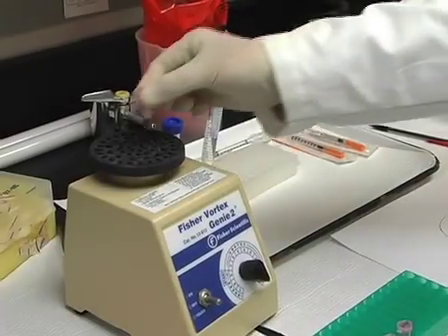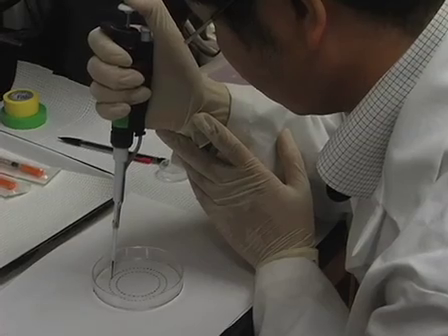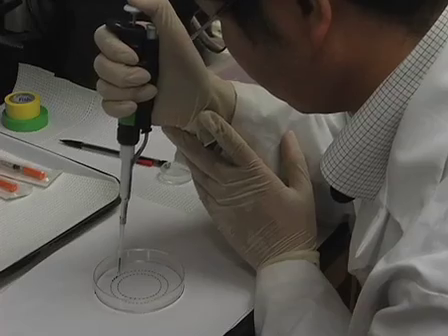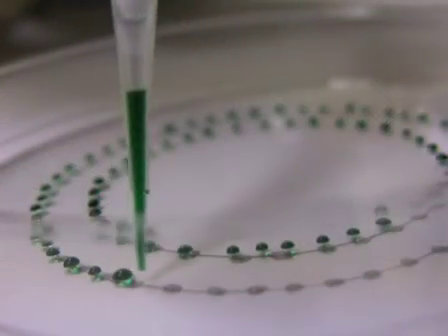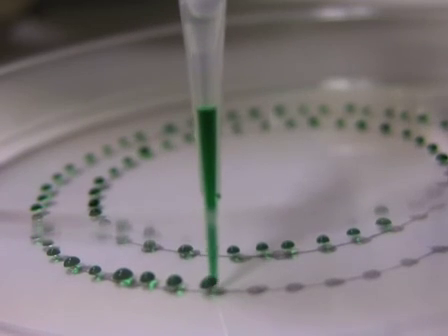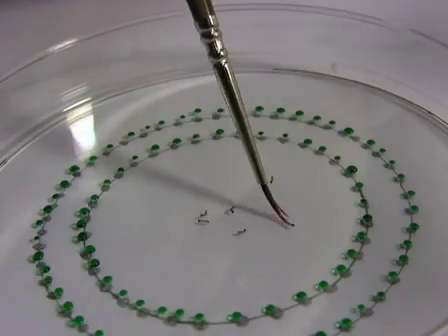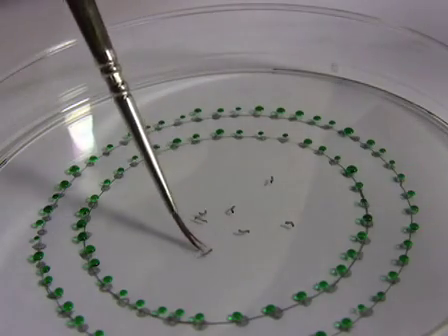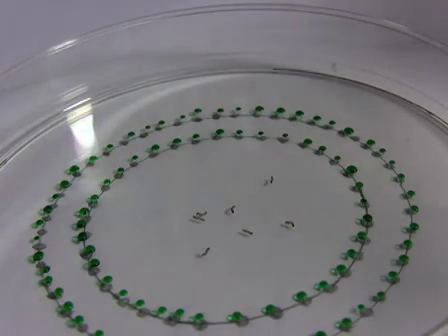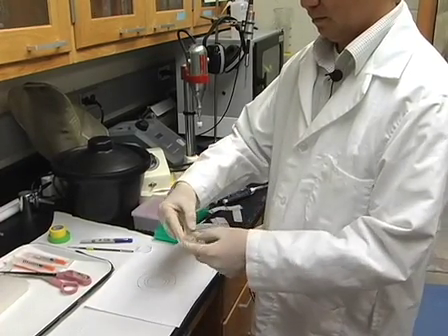After vortexing the tube to prevent settling of the polyhedra, make two concentric circles of small droplets of the virus solution in a 60 mm Petri dish for each concentration of virus used. Remember to also set up a negative control mock infection treatment. Next, transfer 25 to 30 neonate larvae to the middle of the concentric circles using a sterile paint brush. Place the lid on the dish and seal with parafilm to prevent the larvae from escaping.